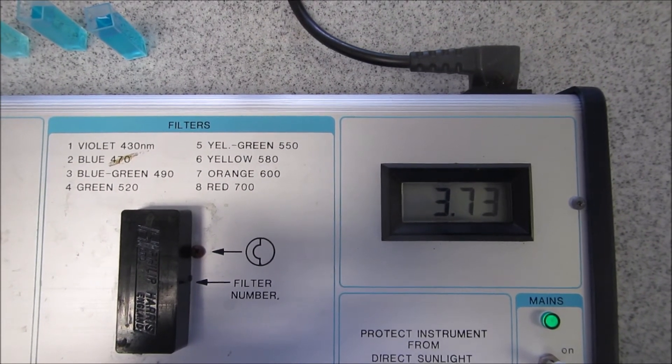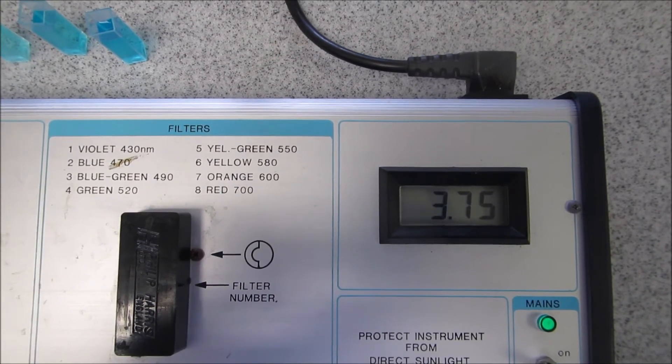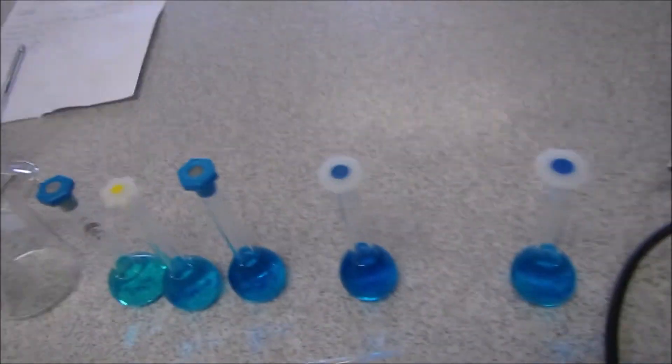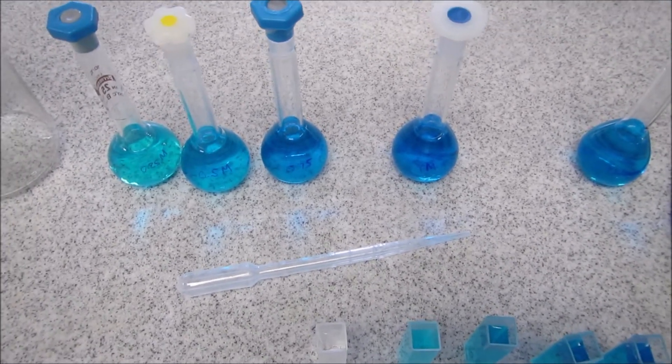It's just taking a little while to settle. Using those you can now produce a calibration curve.